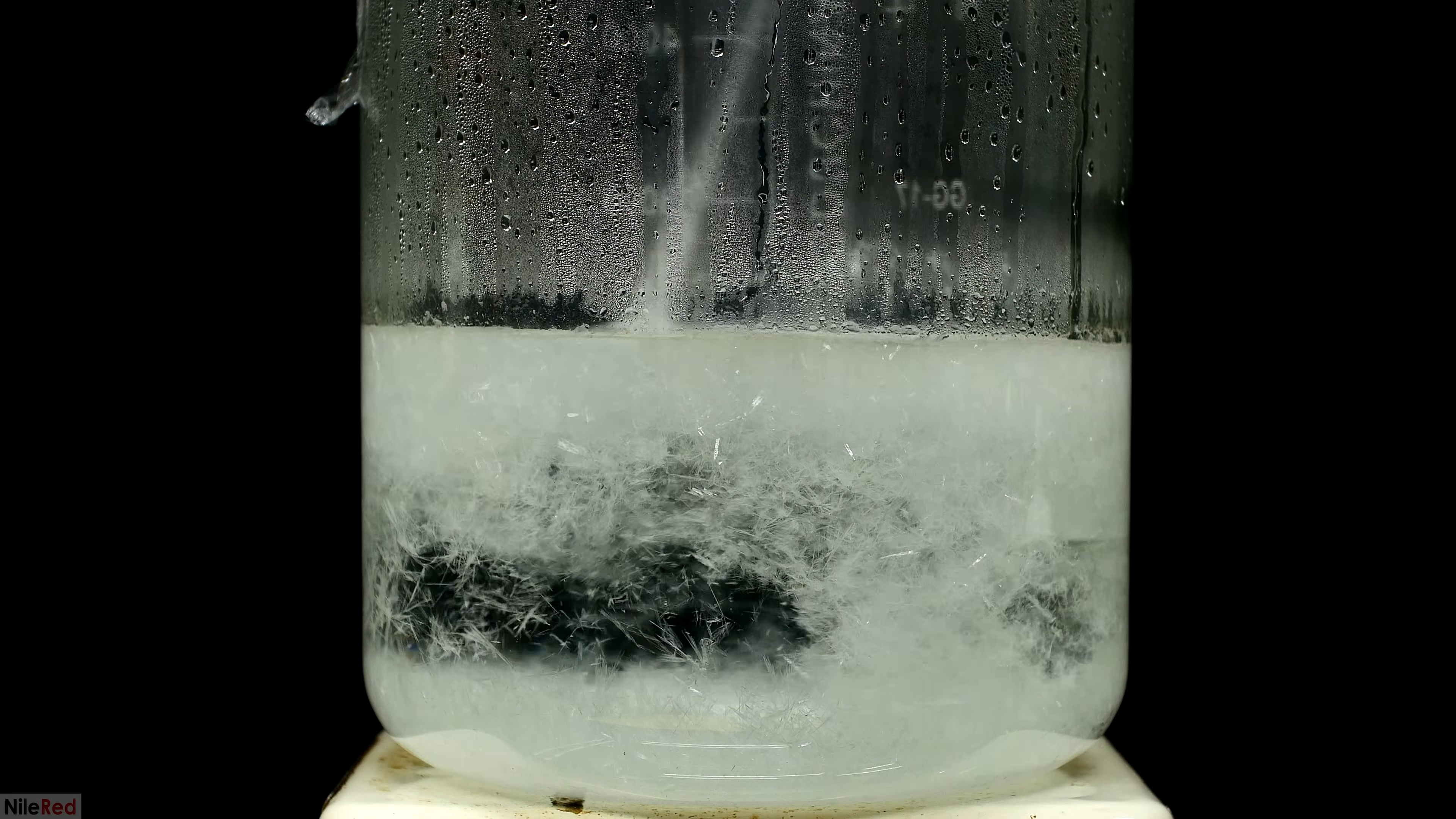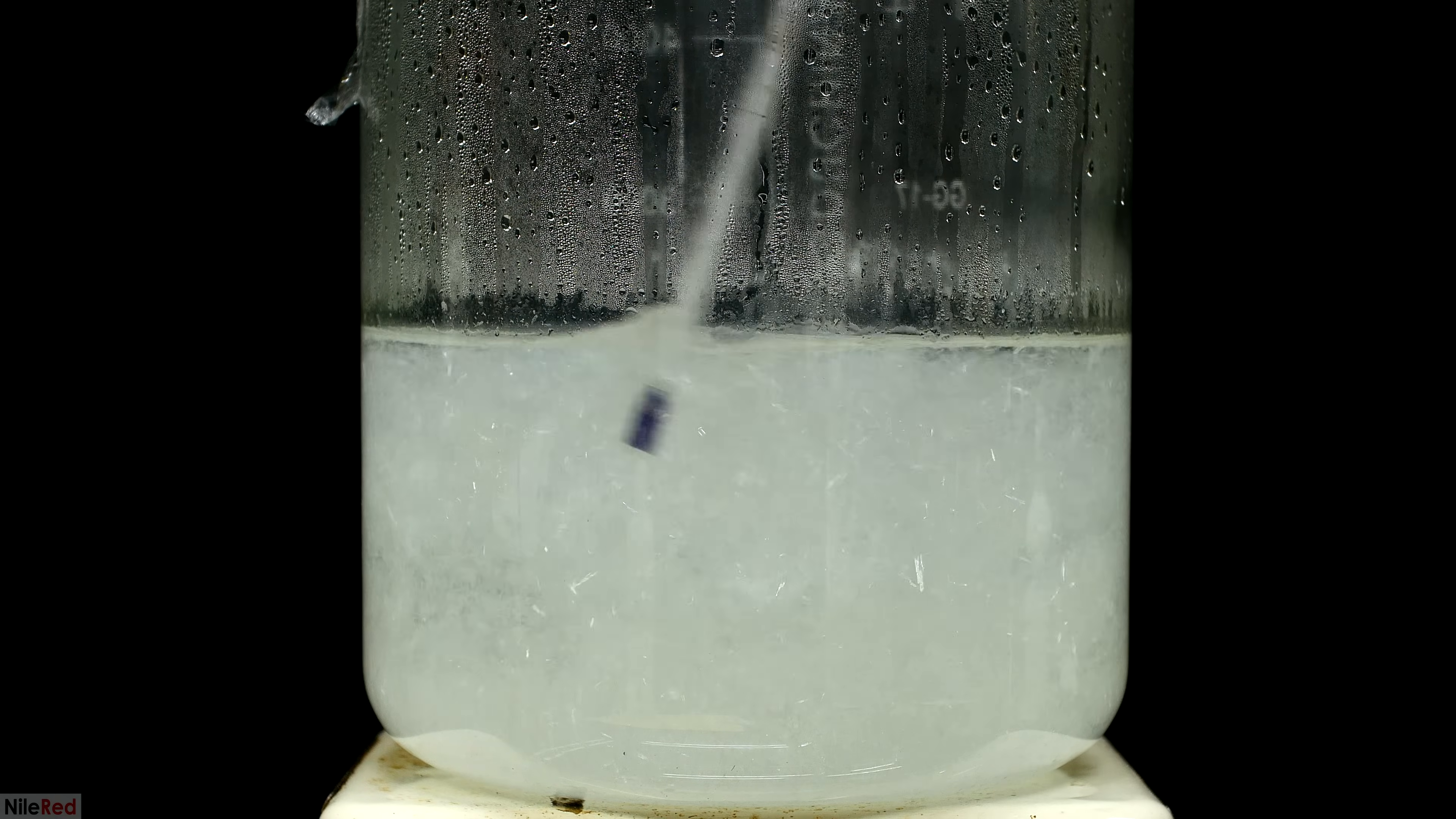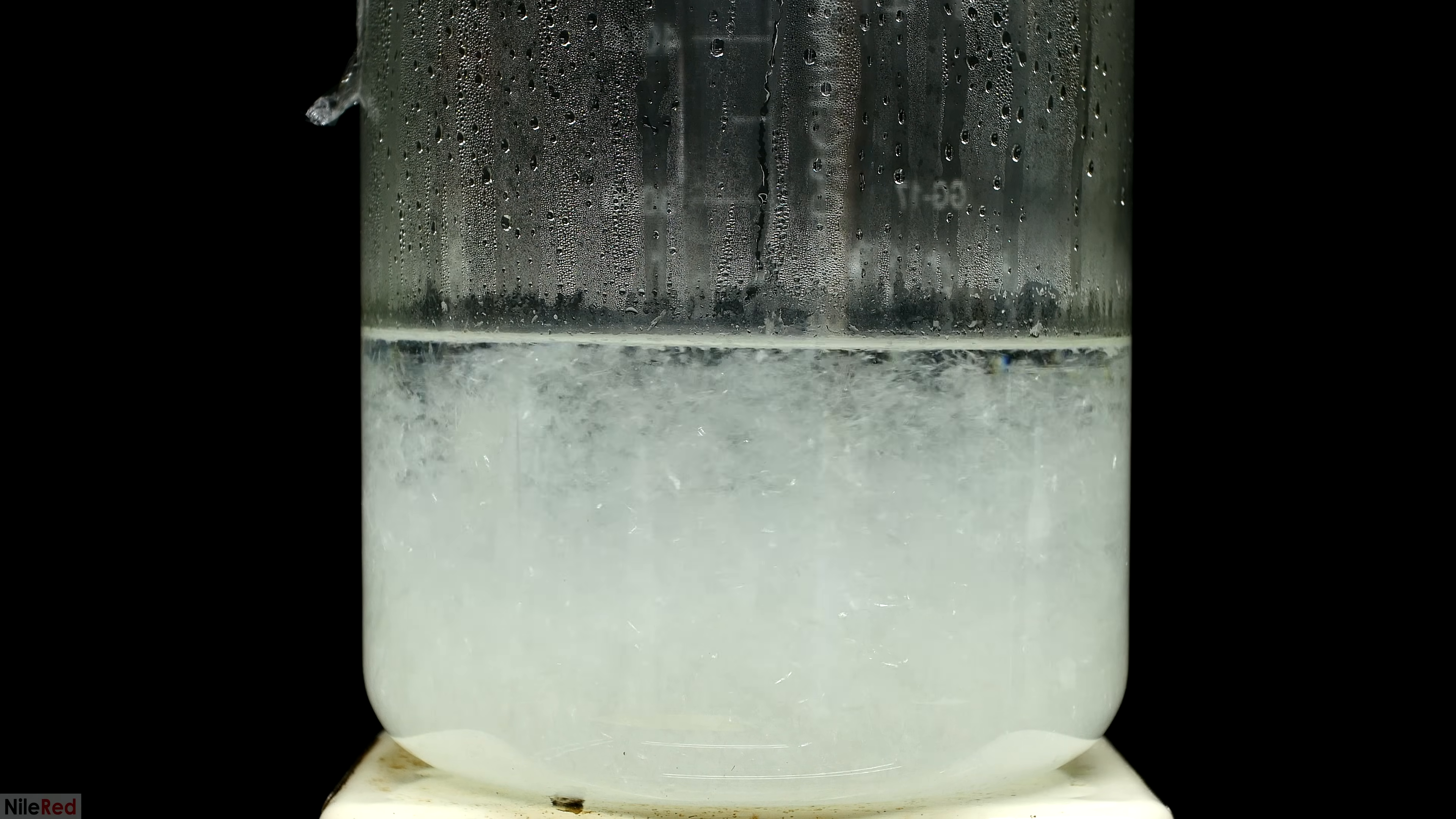It was taking a really long time to cool down, so I left it out overnight. When I came back in the morning, it had cooled down to room temperature and you can see that we have a lot of nice crystals.